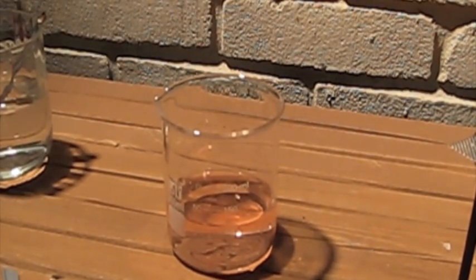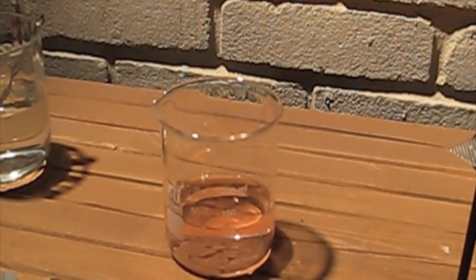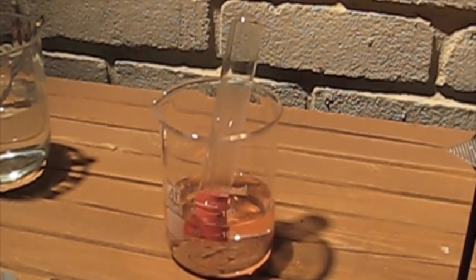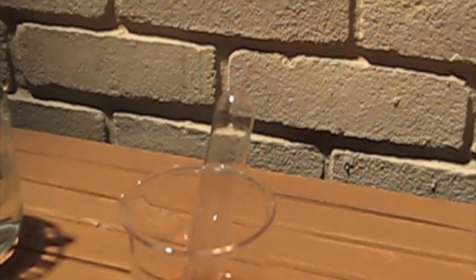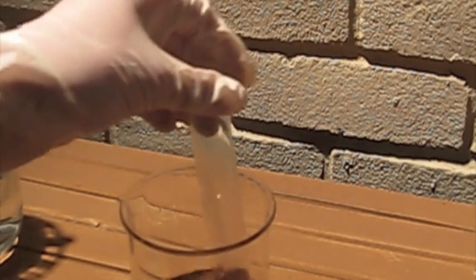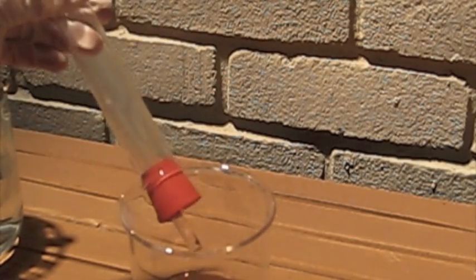And here's some water with litmus solution and tartaric acid which gives it a red color because in the presence of tartaric acid litmus solution becomes red. What should happen is that after I place this in, it should become blue because ammonium hydroxide is a base which would turn the litmus solution blue.